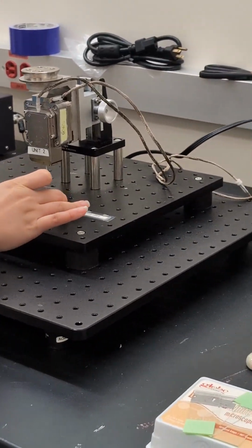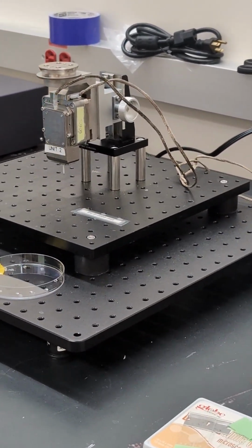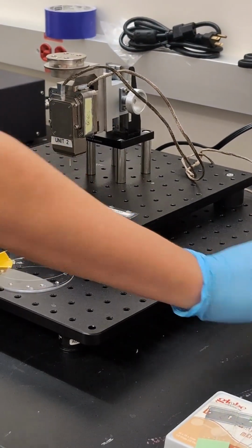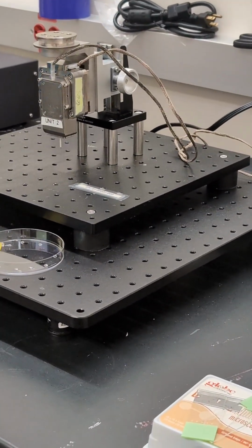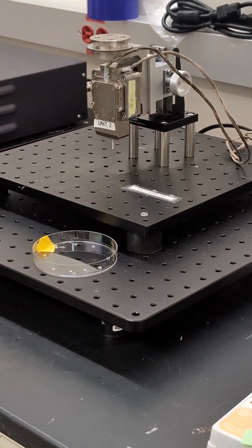You don't want to install the probe before you turn on the program. Since the computer is off, we can just go with it. So the probe is really tiny. Do we have a clean wipe somewhere?